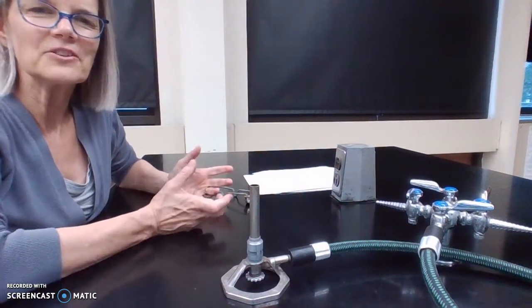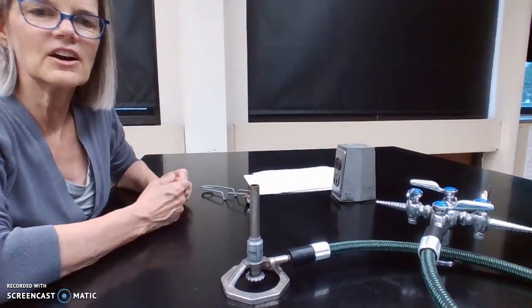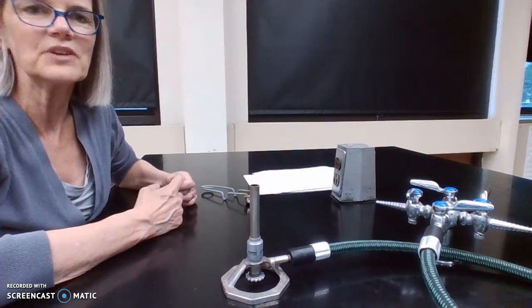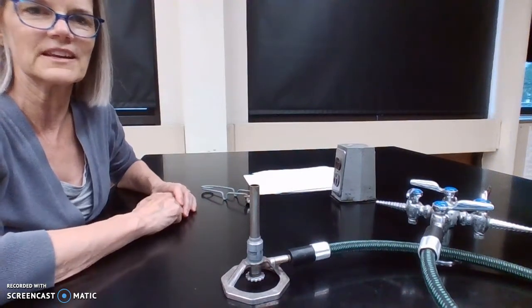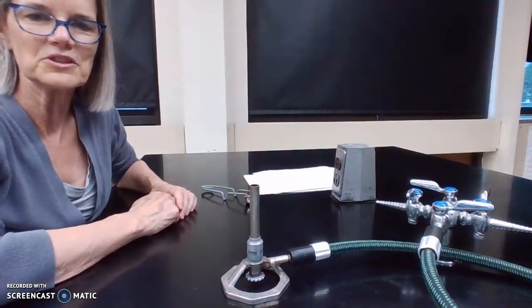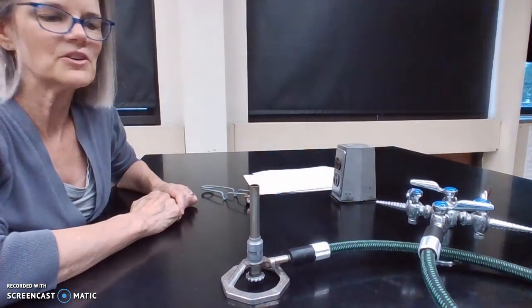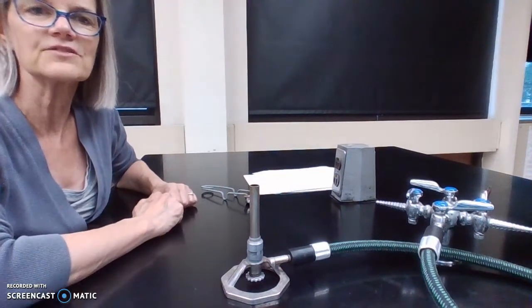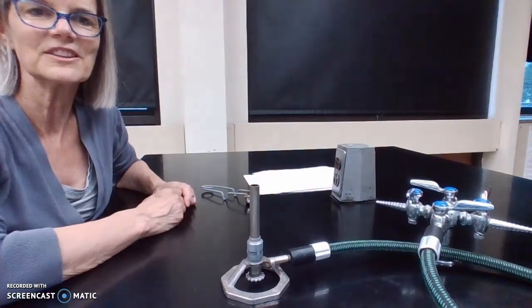A final note before I sign off here is if you're really nervous about turning it on and off, you can always get some help. A lot of people do have the jitters about fire, especially now that most of us don't smoke anymore. In the days when everybody smoked, we were used to using matches. But people aren't as used to that. So if you're nervous about the fire, nervous about using the Bunsen burner, definitely ask for some help from a classmate or from your instructor. Good luck.